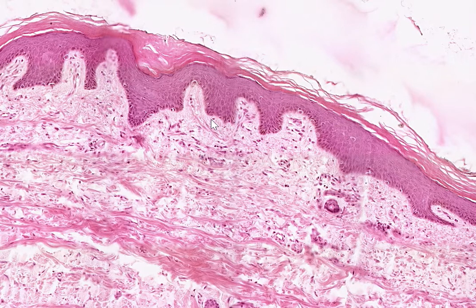Actually, what happens in the skin is that the cells proliferate here from the basal layer. They will travel upwards and they will mature as they travel upwards. They will become more cuboidal, they will become squamous, and then they will lose their nucleus and become this keratin layer. So this is how this keratin comes about.